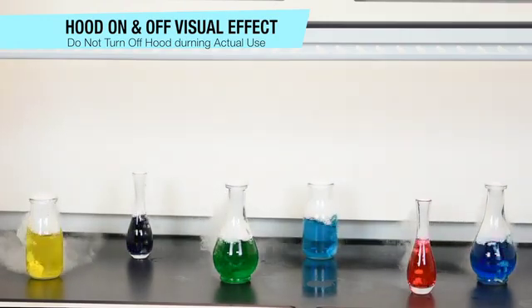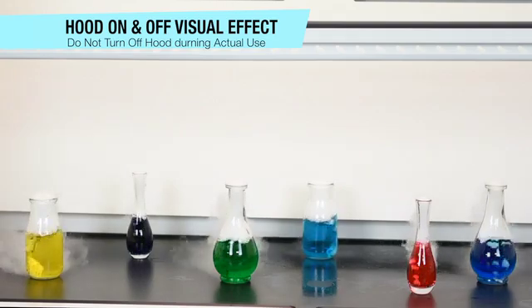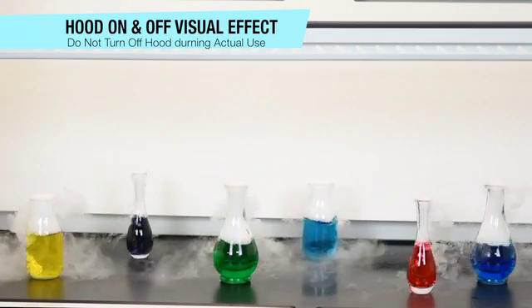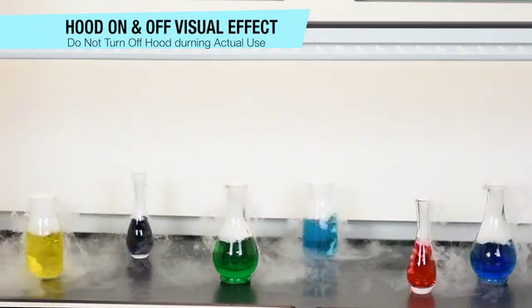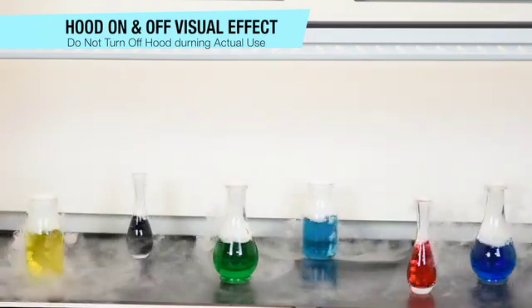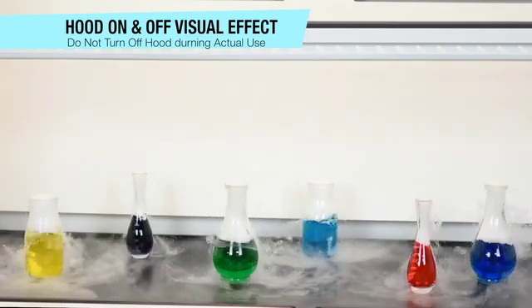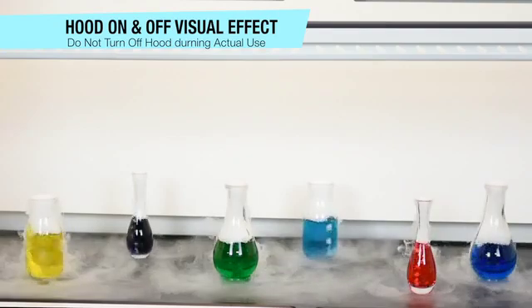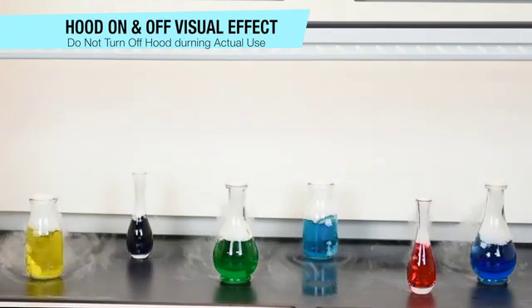We're also going to show you what it looks like when it's not turned on and not functioning correctly. Let's go ahead and turn that off and take a look at what happens. As you can see, the fumes are now starting to escape the hood. And the worst part is they're coming towards the front of the sash where you're breathing. This can be harmful or fatal. I sure don't like the looks of this. Can you please turn the hood back on? Thank you.